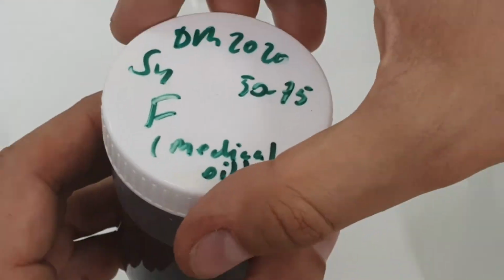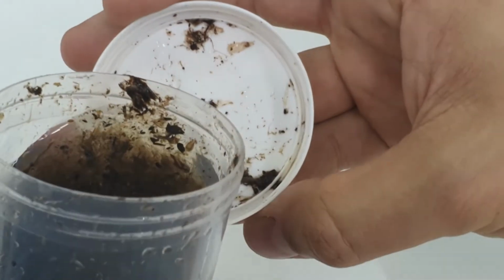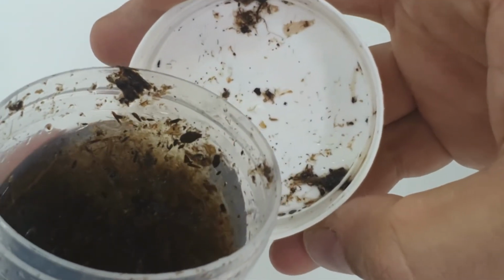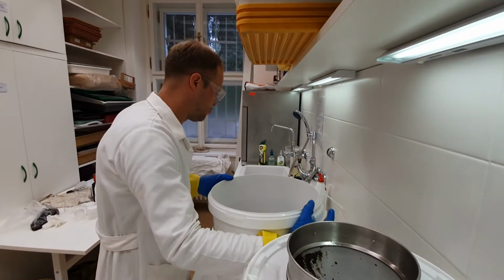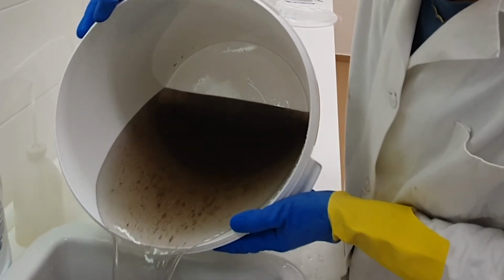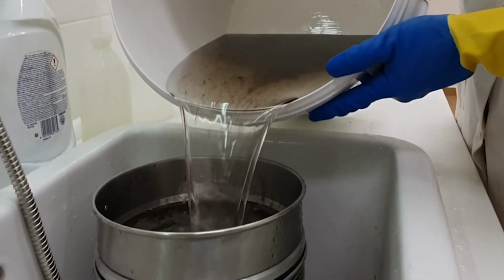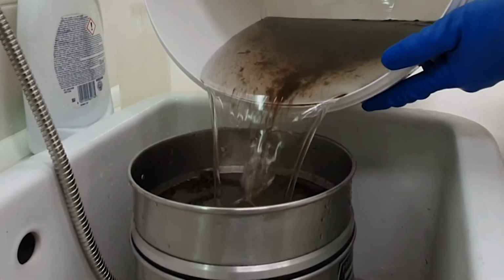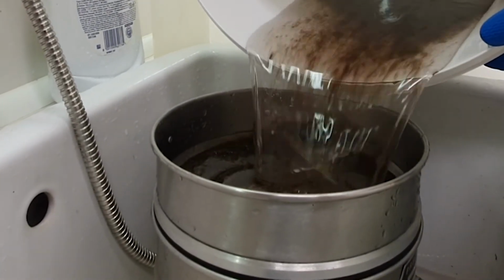If all went well, then at the end you have a float which hopefully contains a lot of beetle remains, and you don't have to go again through the whole sample. Finally, I'm also saving a residue. The residue is also rinsed in oil. I will also have to clean the residue with soap before putting it back in a bag and maybe float it later, or just save it just in case.